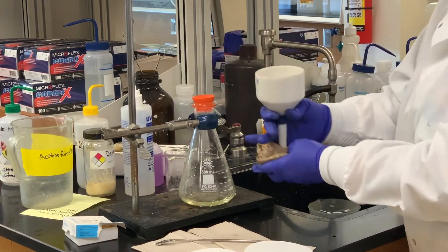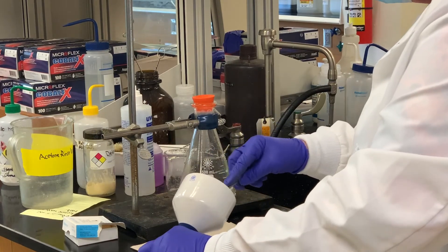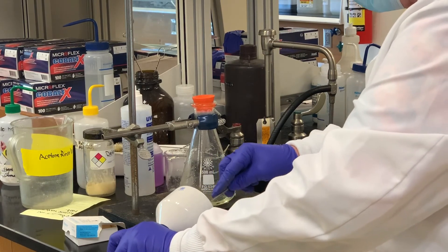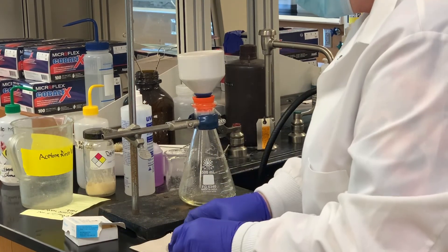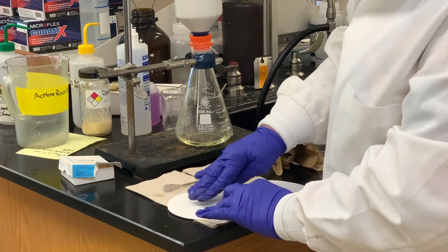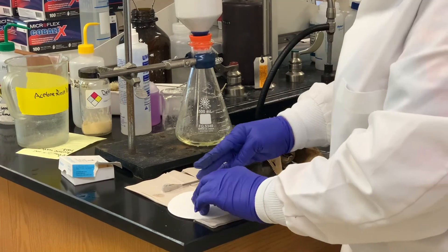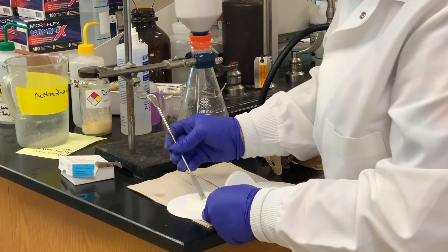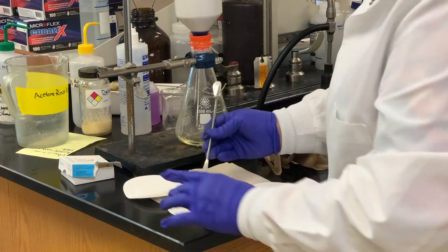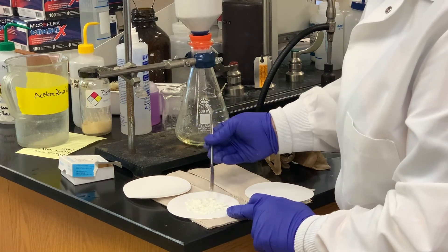These are a very white crystalline solid that we've collected. I'm going to remove this solid, put it on some filter paper, and squeeze it to get as much of it dry — get as much of the ethanol off as possible. We want to take a melting point and a weight. I'm not seeing much moisture on the filter paper, so I'm going to let this just sit and air dry a little bit, crunching it up and breaking it apart.